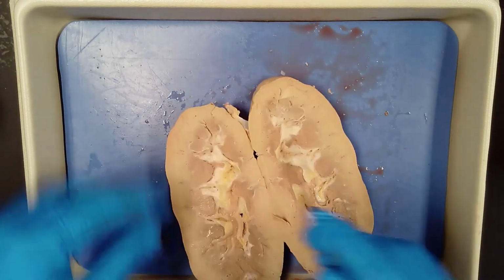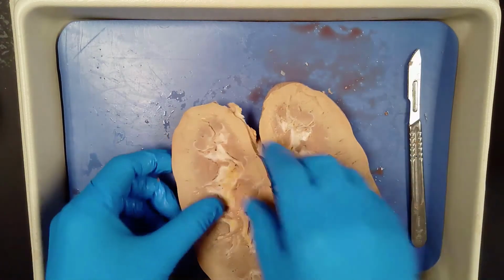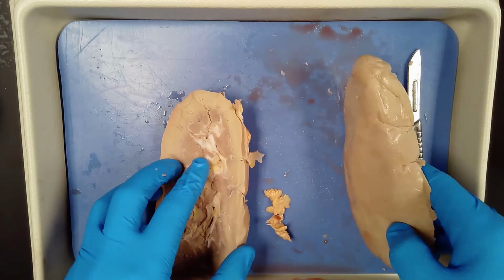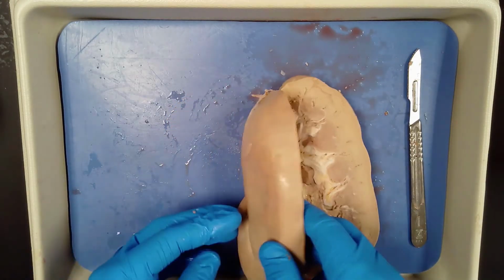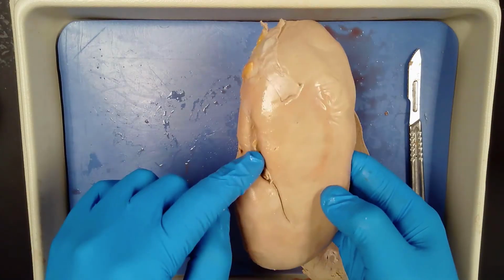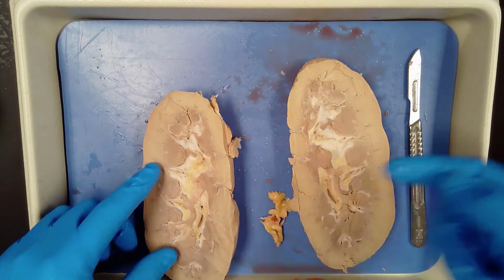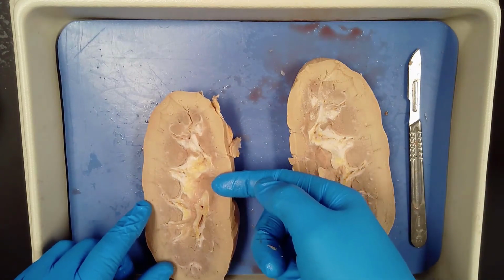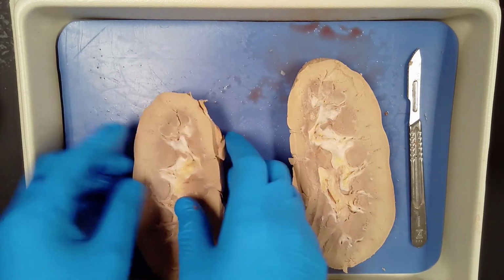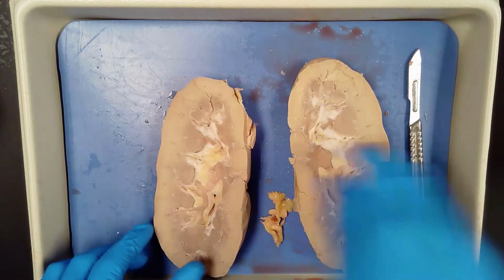But that seems to be pretty good there. Okay. So what you'll see is, again, this is the medial aspect here. Okay, here's the medial aspect, so I just want to orientate you with that. Okay, so in comes the blood. Okay, and the outside portion here is what we call the renal capsule. So this is my renal capsule, and then you'll see kind of two different colors in here.